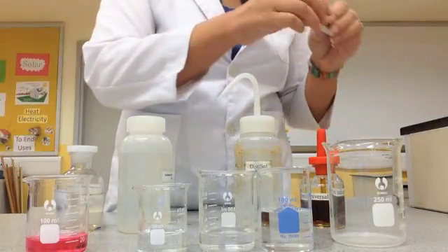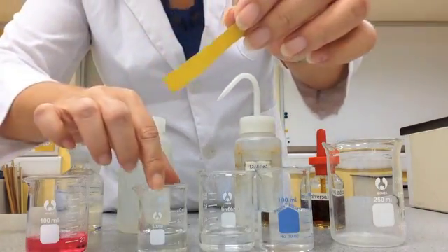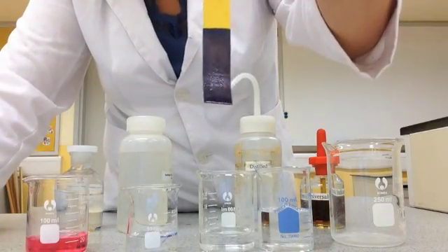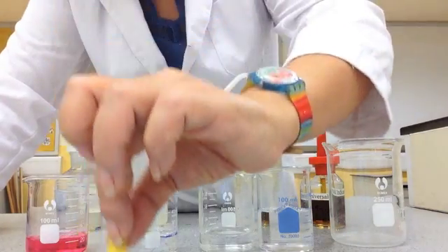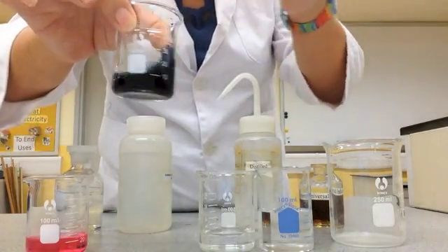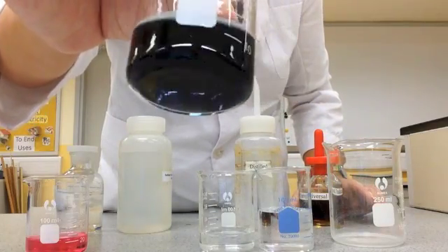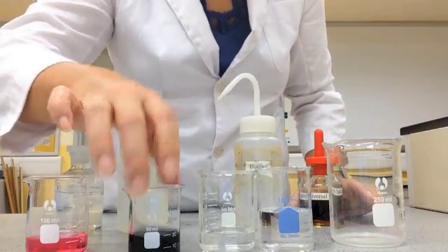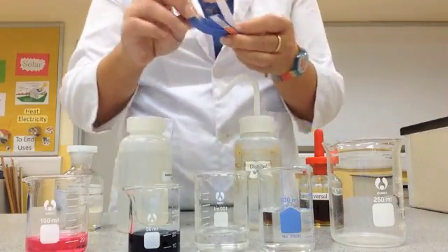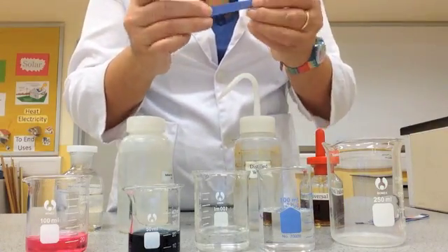But does the litmus paper tell you the pH value? No. So let's try using the yellow paper indicator — look at that, it turned a really deep purple. Then I put some liquid universal indicator in it and it also turned dark purple, confirming it's a strong alkali.